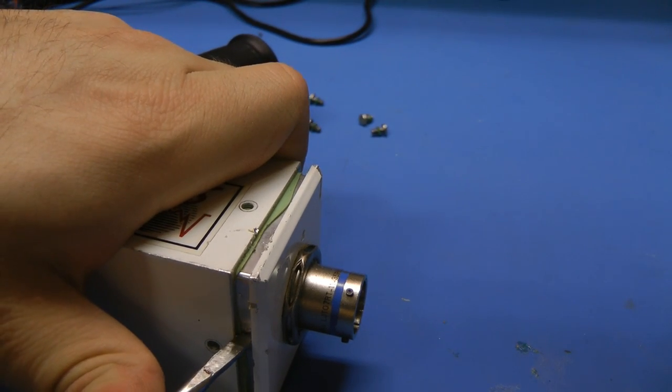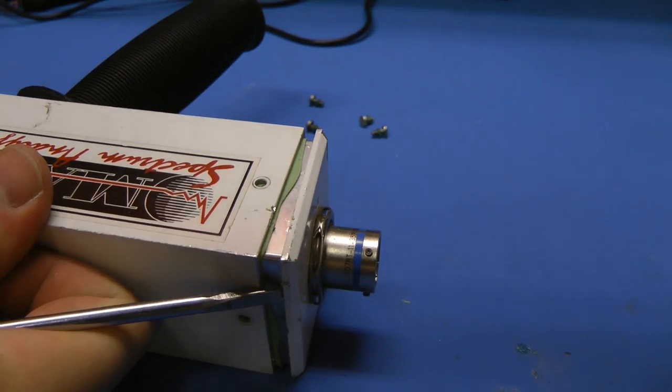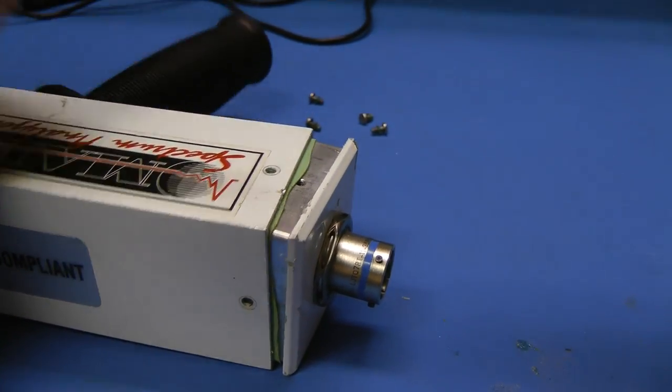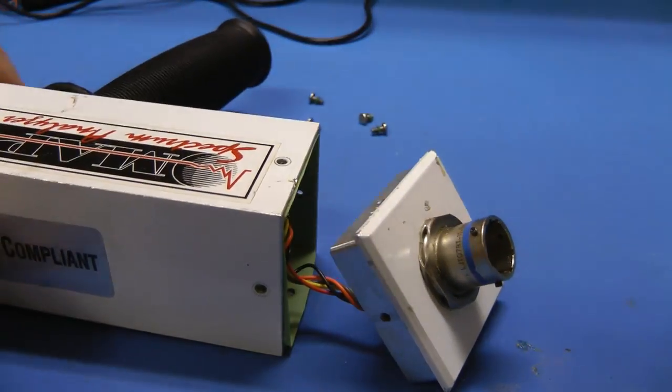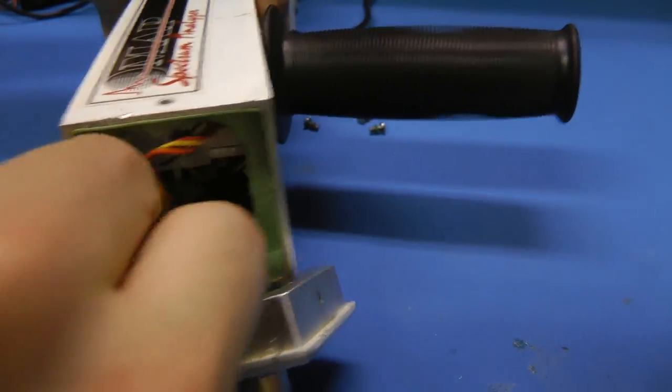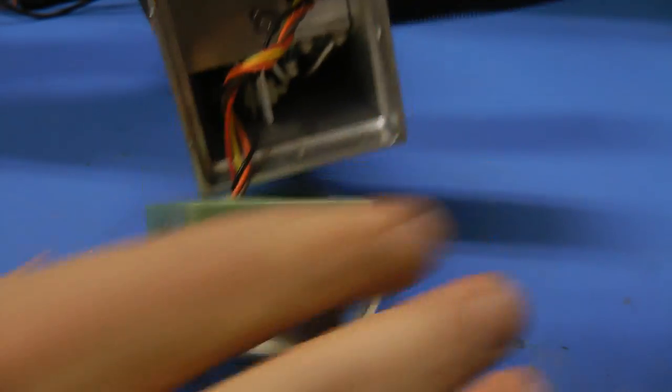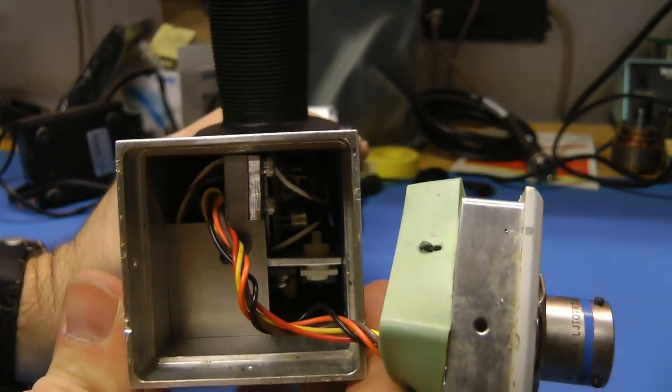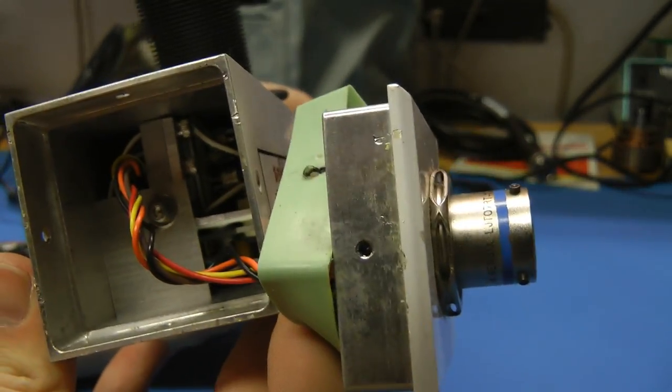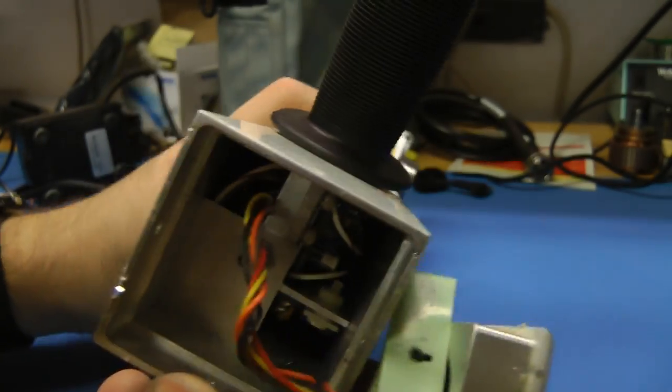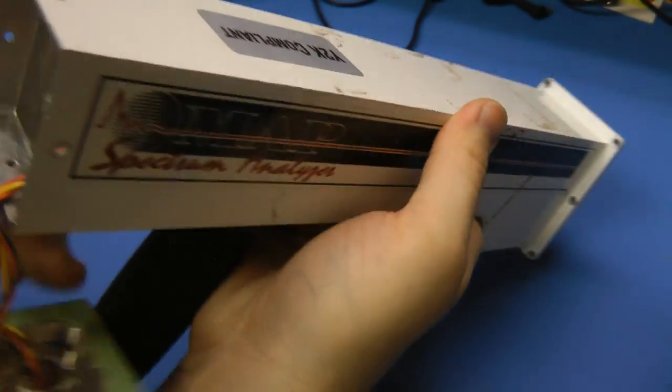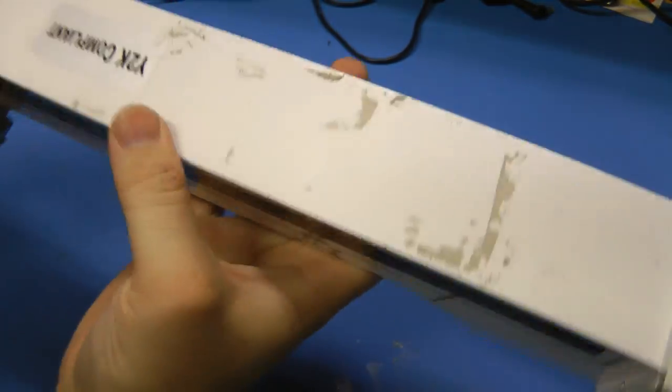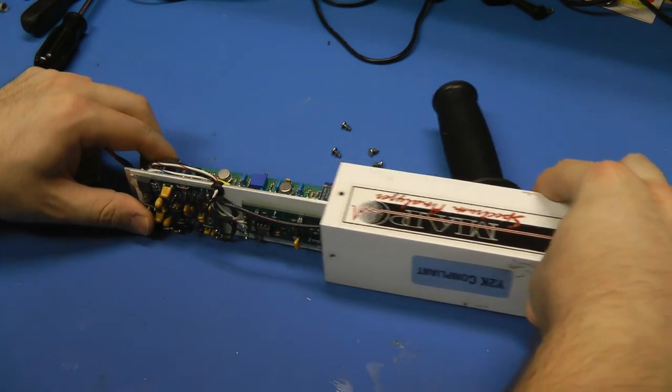The back of this thing is held on quite tightly with some sealant or gasket, sort of an O-ring. Let's see if we can try and figure out how to get the inside section of this out. Yeah, this O-ring is really holding it in tightly. There we go. Okay. Oh yeah, that's all machined. This has a decent length on it. And there's that gasket, so sort of like a molded rubber piece. This thing is finally free now. I just had to remove a whole bunch of screws.